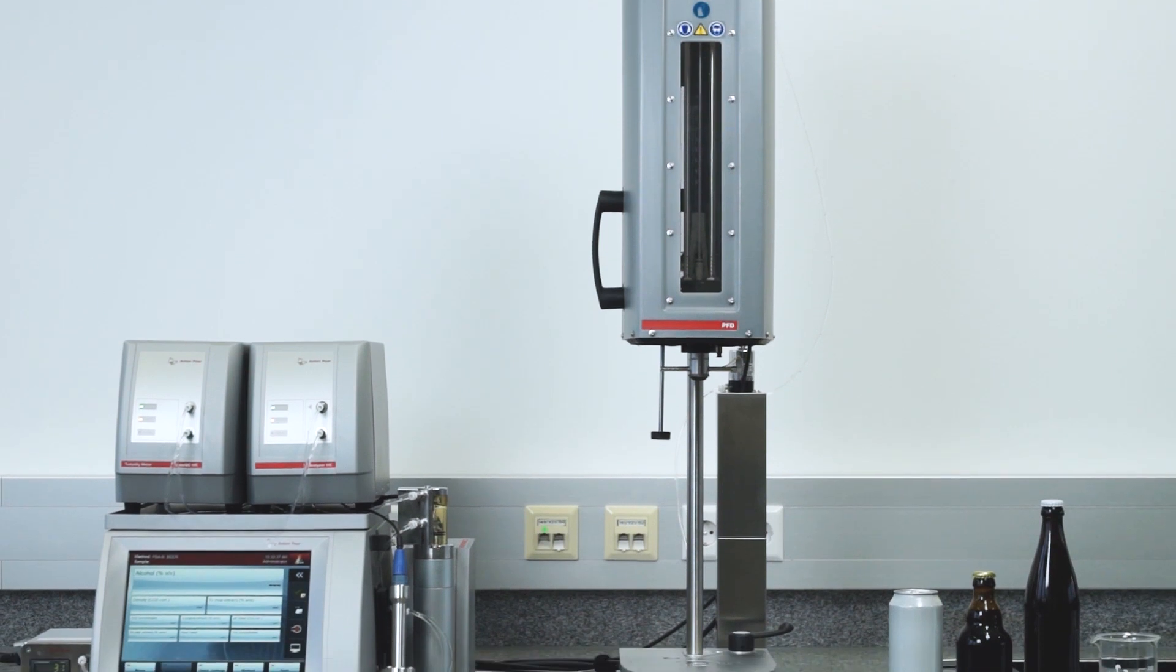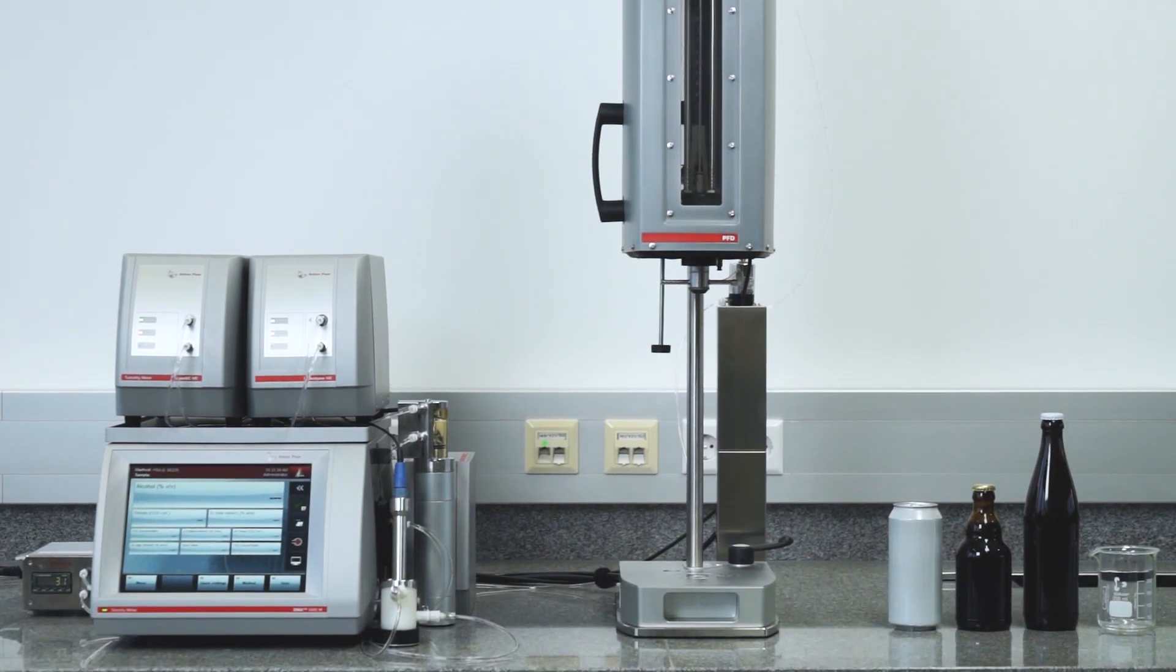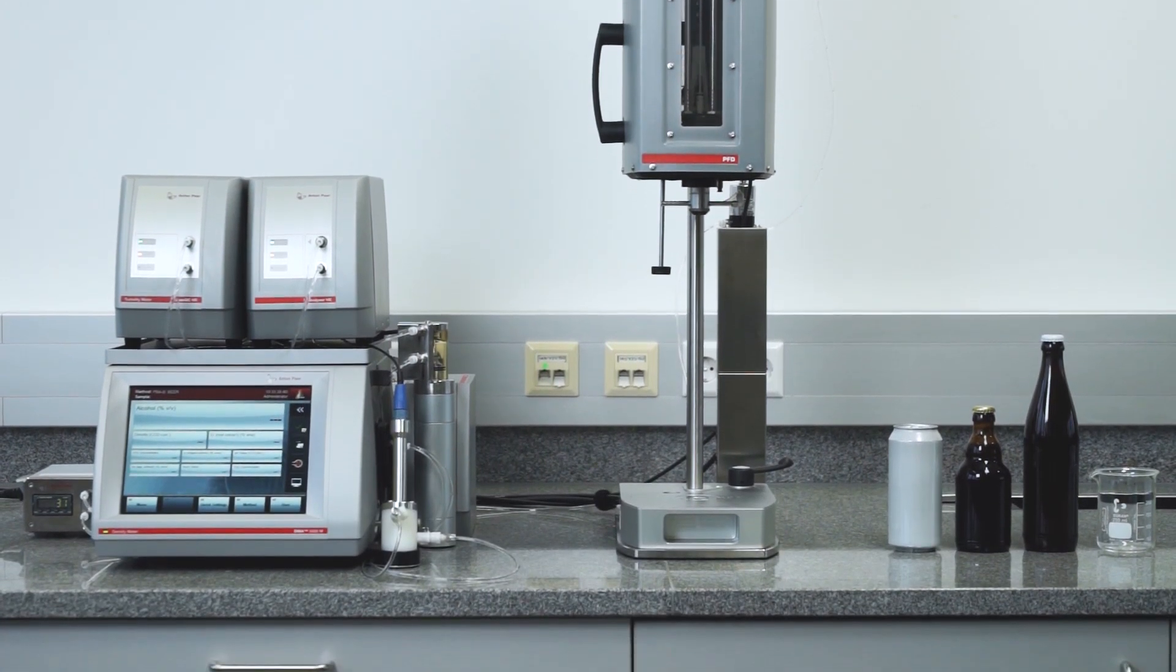To prepare your PBA system for routine analysis, please make sure you have all the required equipment handy.